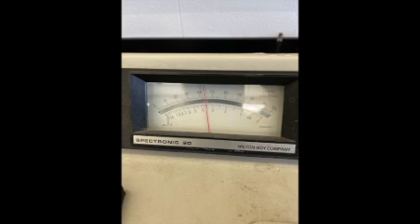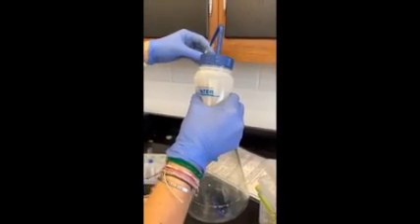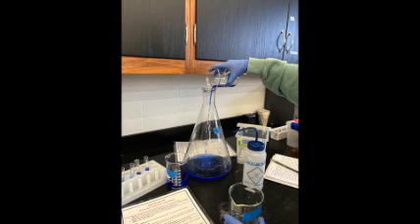Record the absorbance for each solution. Before you prepare the next solution in the cuvette, use the fill-dump-fill method to clean the cuvette. All copper-containing solutions should be disposed of in the indicated copper waste container. Do not pour them down the drain.